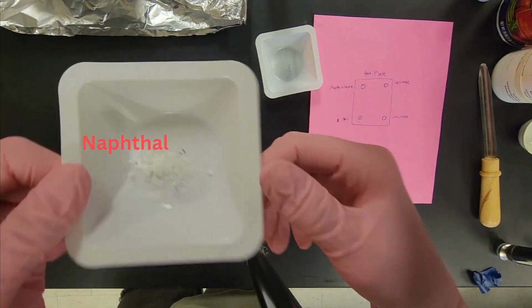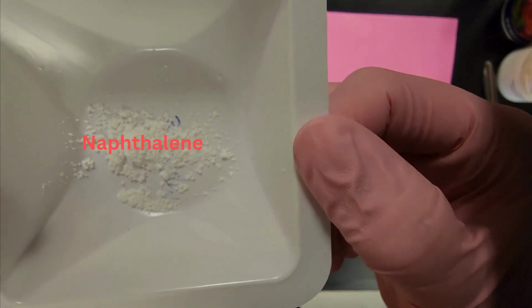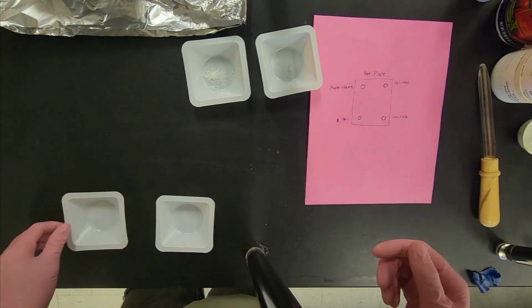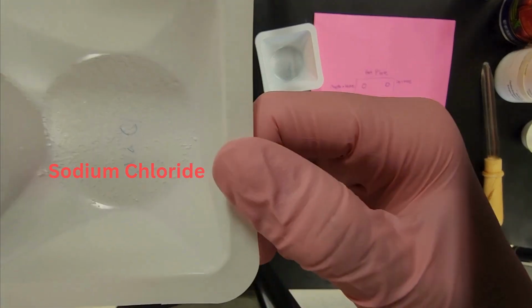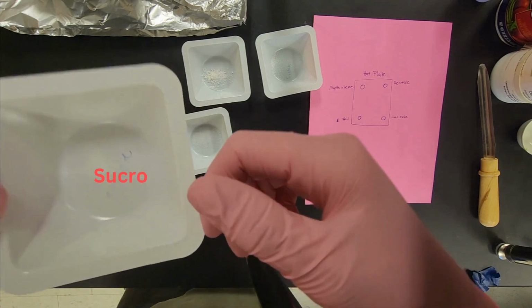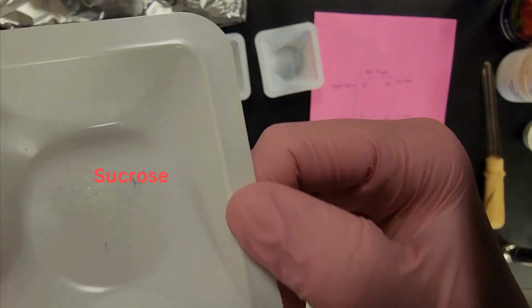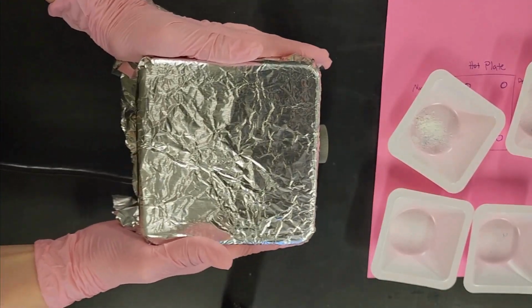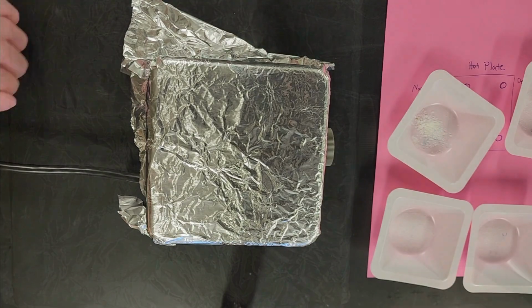Next, we will look at naphthalene, which is a 2-ring aromatic hydrocarbon. It's a white powder with a characteristic odor and is most commonly used in mothballs. I will also be using sodium chloride, which is most commonly known as table salt. Finally, I will be using sucrose, which is also known as table sugar. It's a disaccharide consisting of glucose and fructose, commonly found in sugarcane.